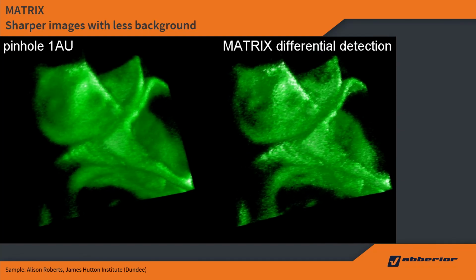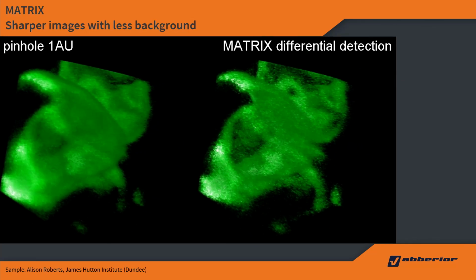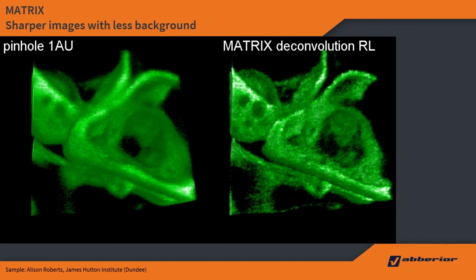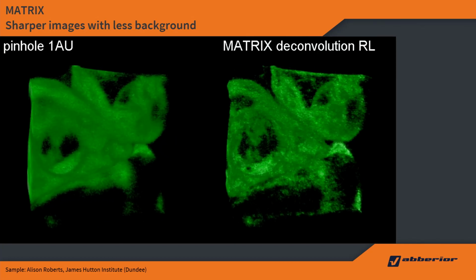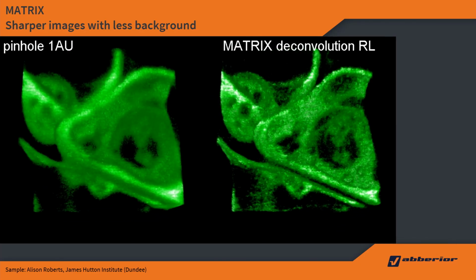Here's a movie, basically a rendering of a volume acquired in confocal and matrix mode. On the left we see the normal confocal image, on the right the matrix in differential detection mode. You can already see gaps which are not visible in the confocal mode, and with deconvolution on top you can see a lot more detail and gaps which are usually obscured by haze. With this I would like to finish the matrix part and move on to STED microscopy.